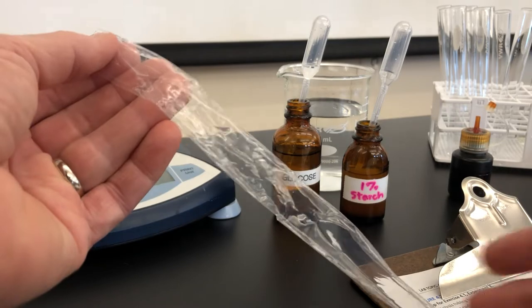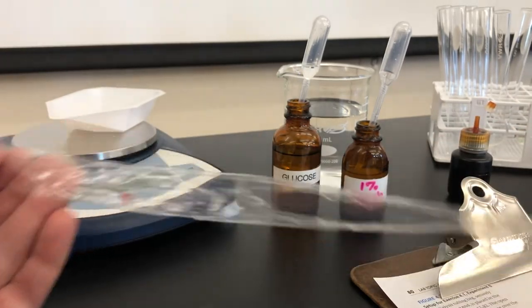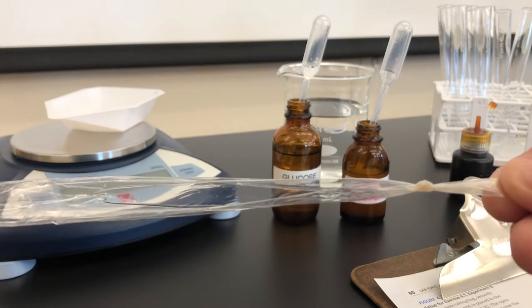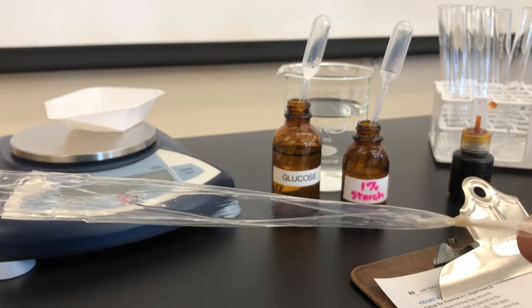Now I've soaked it in water and it's become a nice flexible membrane and tied it off on one side with just a simple slipknot. I prefer that over using string or rubber bands.